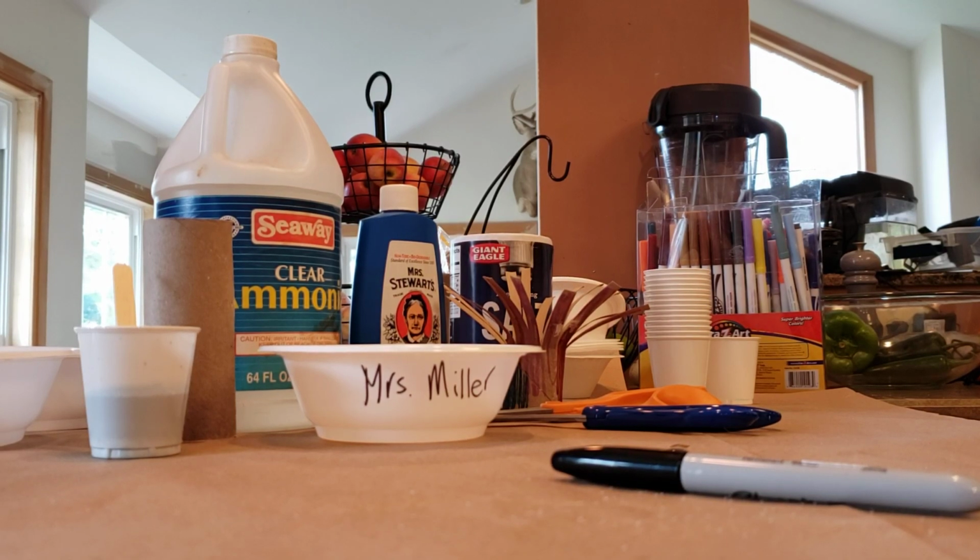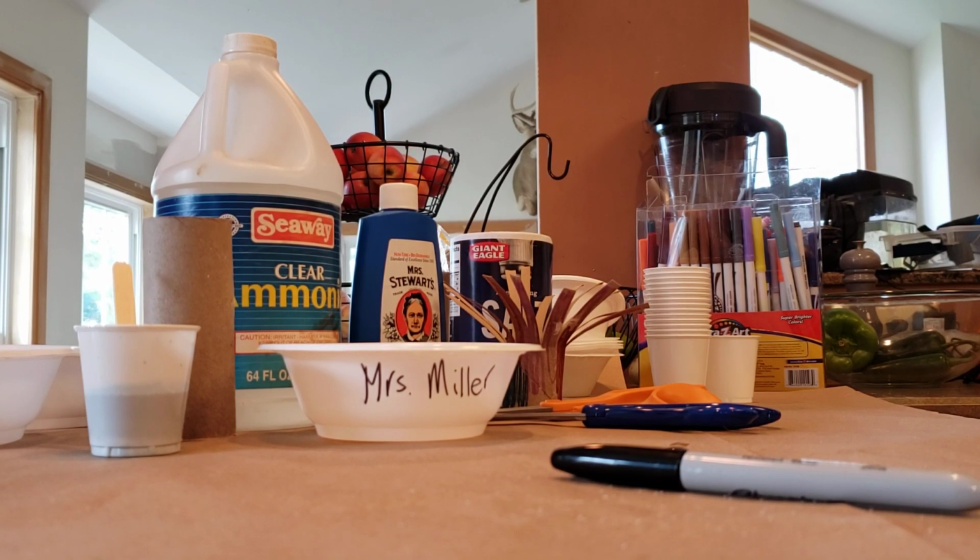Okay, sixth graders, today I'm going to show you how to do a lab called Crystal Trees. In this lab, we will be making something that will create crystals. And your job, after you watch this, is to fill out the lab, defining crystallization, completing the hypothesis, and then making some observations.